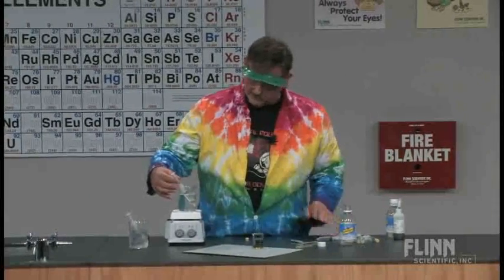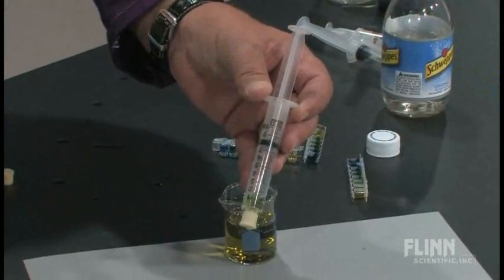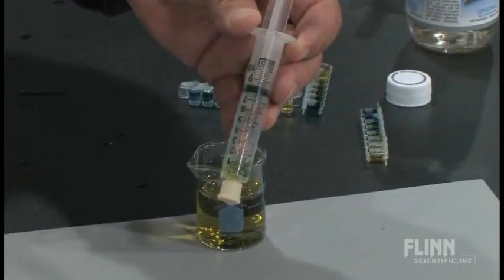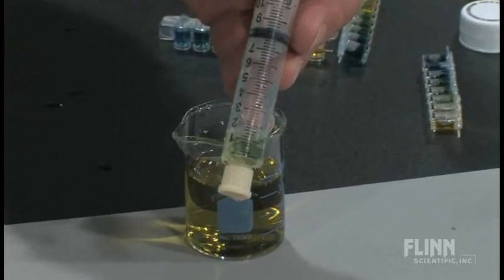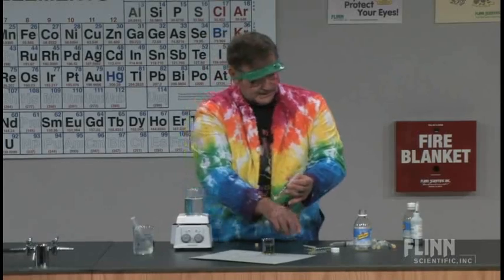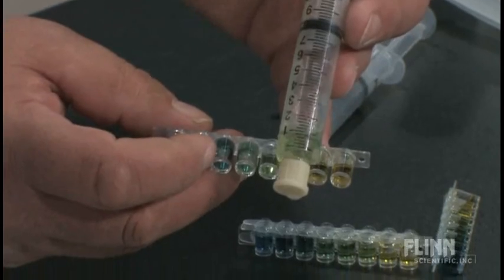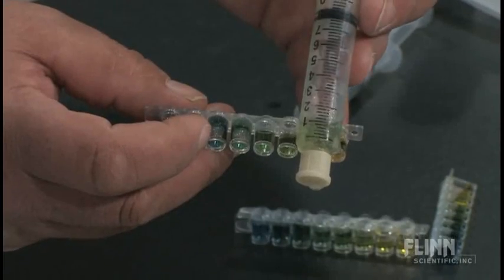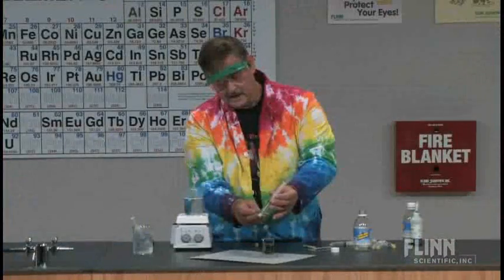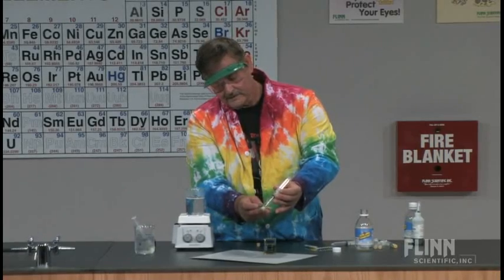My hot one's doing great. Can you get a close-up of that? Remember, it started out at 5, and it's well over 7, approaching 8. And my color changed as well, so I could check that. The kids can eyeball this and they're pretty good - their eyes are much better than those of us who are over 50.